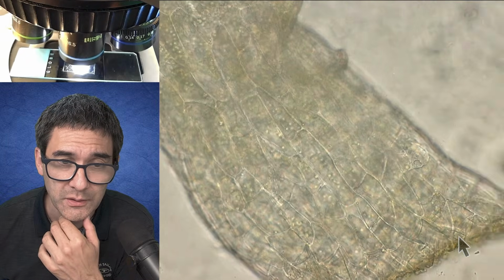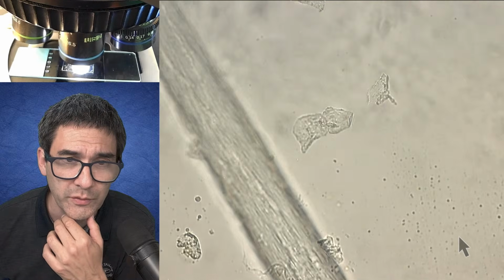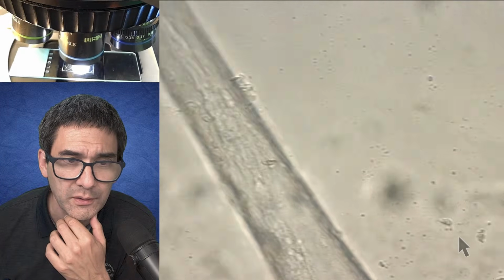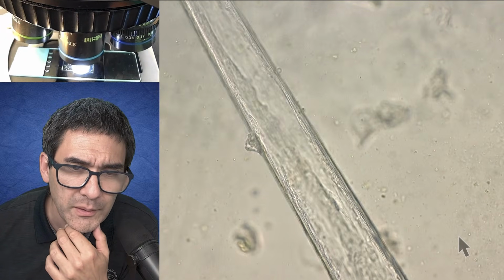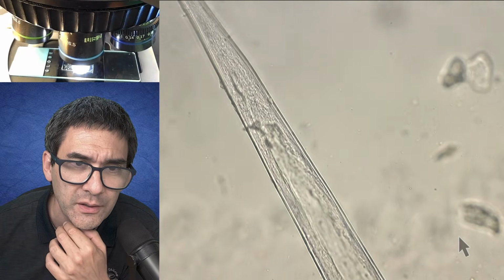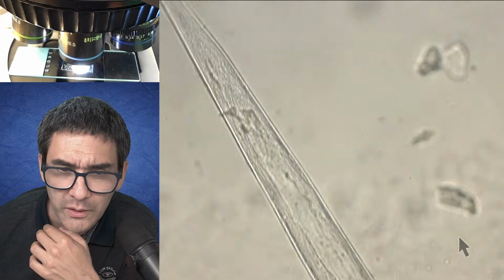But you see here, this is no, that's not one. Here it starts. Yeah, this is a huge one over here. I mean, it's so different in size that it must be a different kind. And something that I'm not able to see here, but maybe you're able to see a little bit of a canal on the inside where the liquid is actually passed out. No, can't see that quite well here.